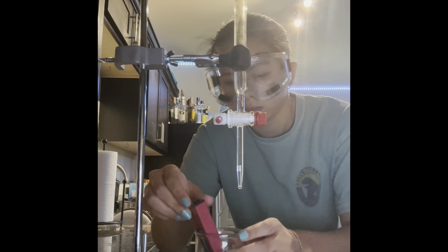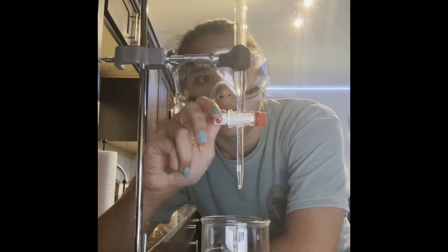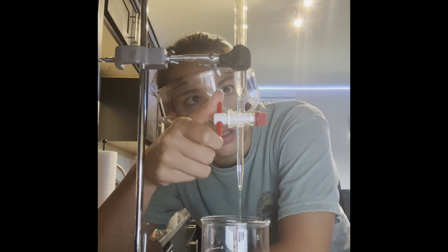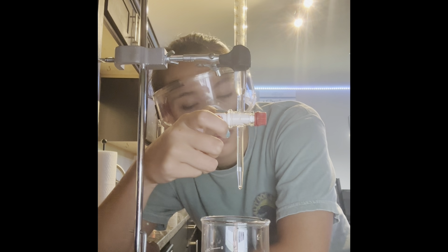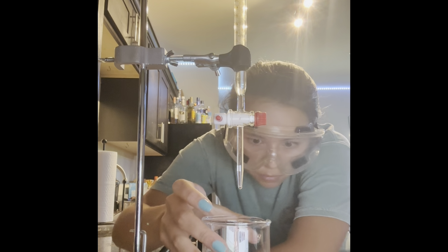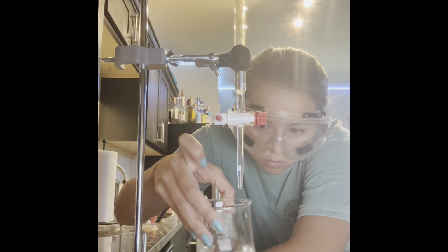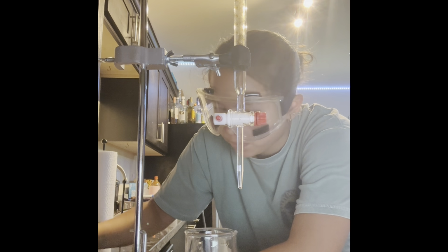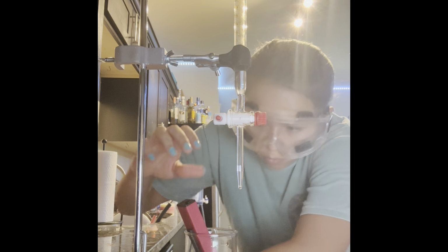So now we're gonna slow down a little bit. 4.7.